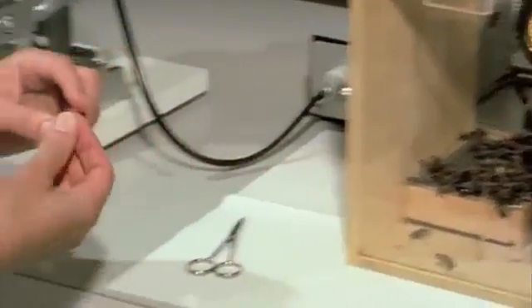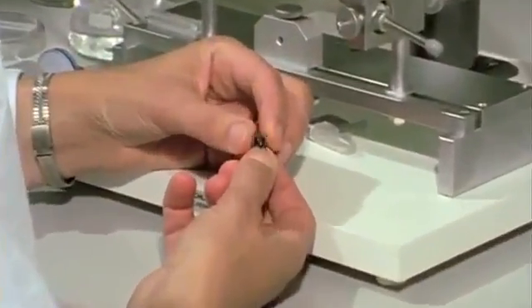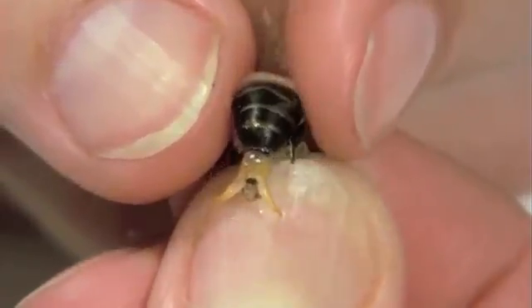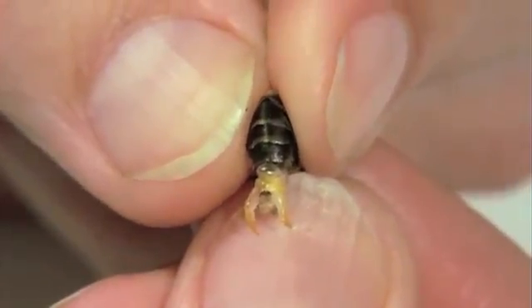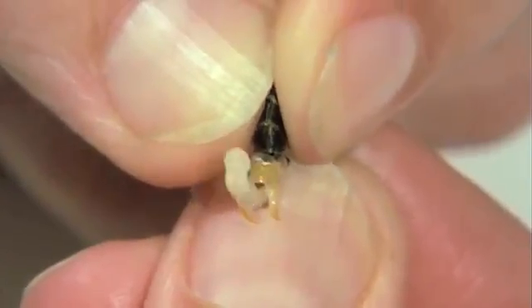Drones which have been reared in cages by workers are used as semen donors. Rolling and pressure on the thorax and abdomen affect the first phase of eversion of the copulative organ. Further pressure results in complete eversion and ejaculation.